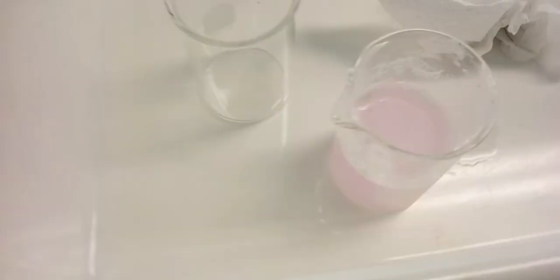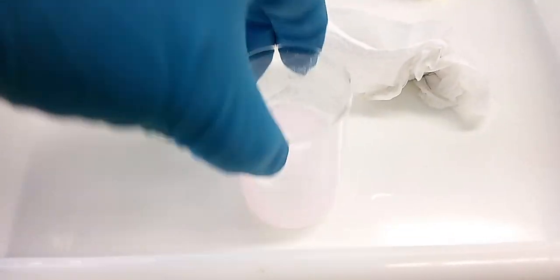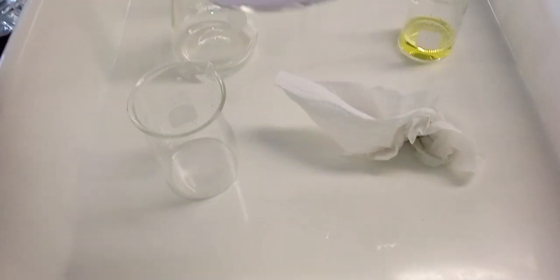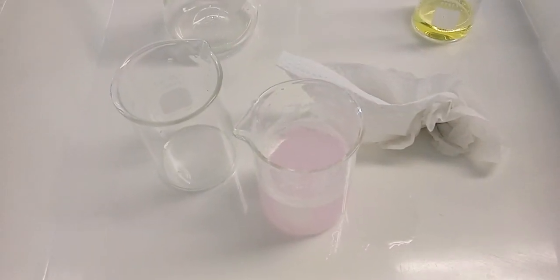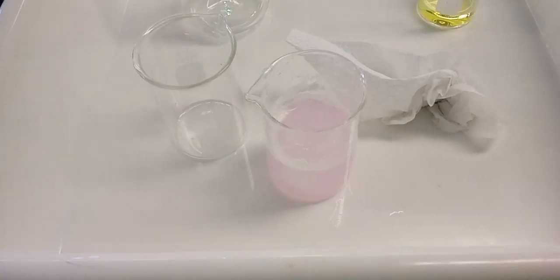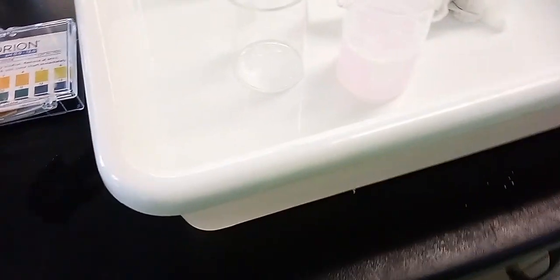Also, I got a little bit of phenolphthalein solution in here. It's a little bit pink. It has water from the tap, so it seems to be a little bit basic, the water. Usually the water that comes from the tap has a pH between 6 and 9, and if it's a little bit basic, it's going to be slightly pink. It's not a very intense pink, so the water today seems to be a little bit on the basic side.